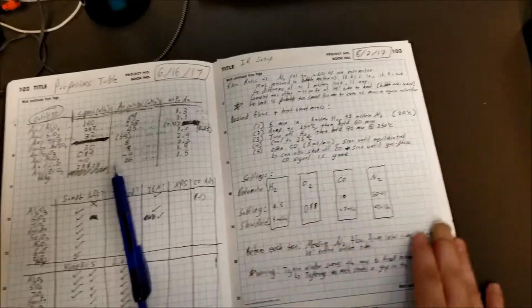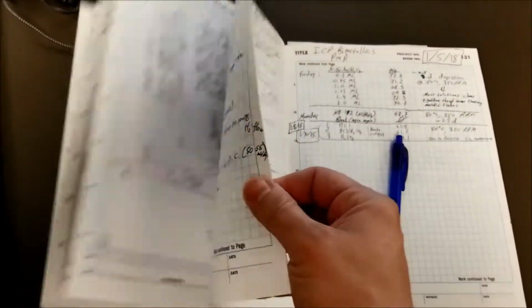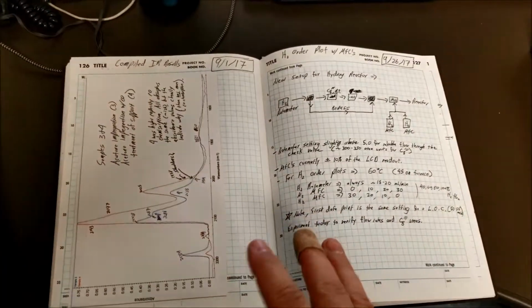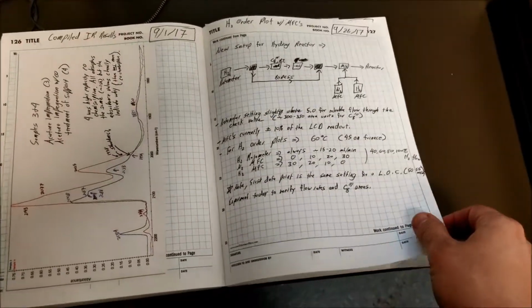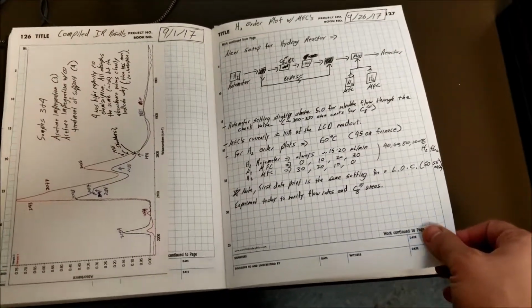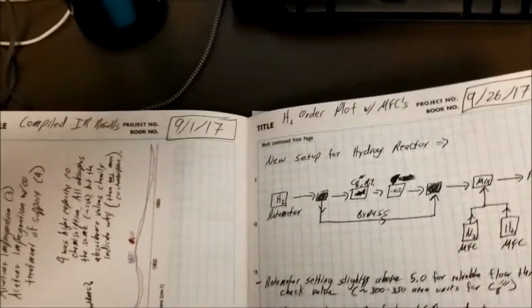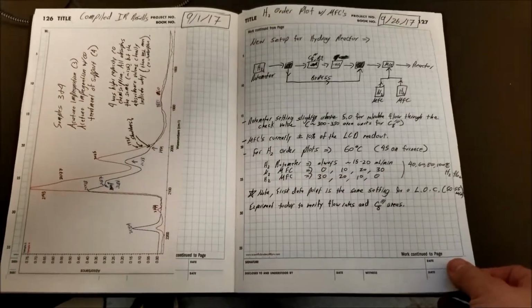Then you get to this section called IR, set up on page 103, and this will go about another 25 pages. These were some IR experiments that we were doing for Rice, and they may or may not have that published in the next year or so. I'm not sure they need anything else from that. See, the date here is 2017, and they haven't gotten back to me yet. So I think that's all being worked through on their end.